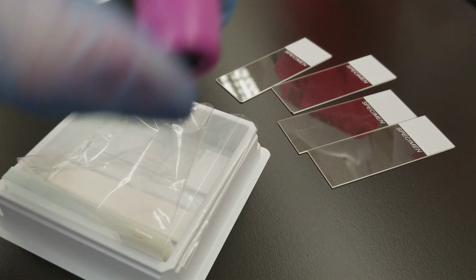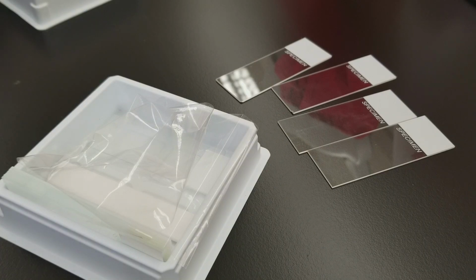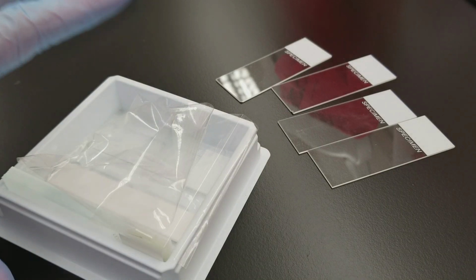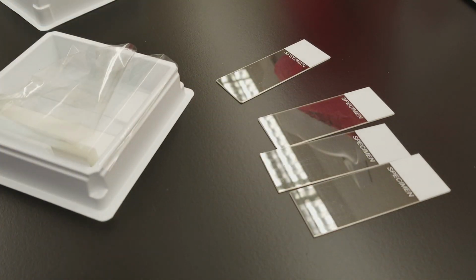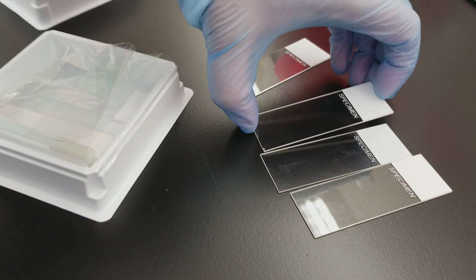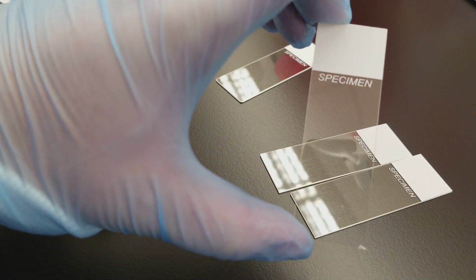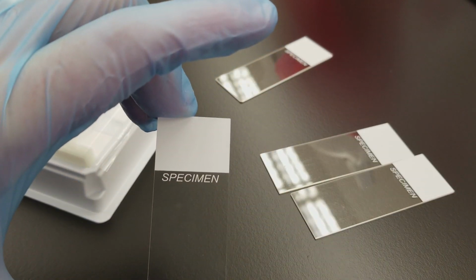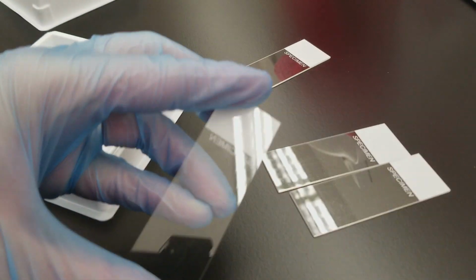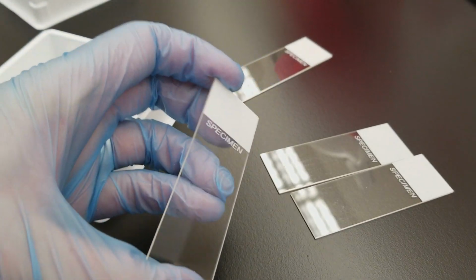Okay, so this is going to be really fun. We have a new technique that I want to try out and see if we can do this. So what I want to point out here is first, you need to have slides that are on the right side. In order to know that your slide is the correct face up, you should be able to read the word specimen from left to right. If it looks like this, that's the wrong side. Okay, so keep it this way.